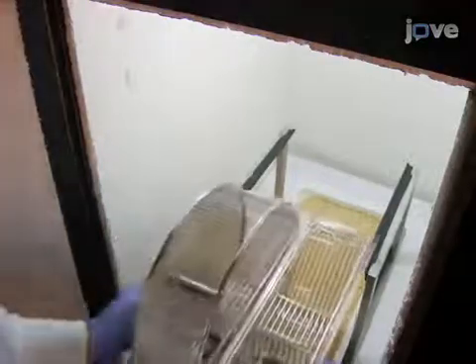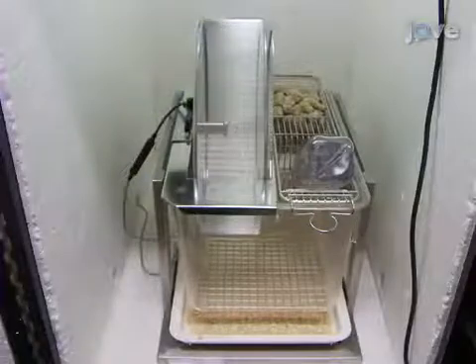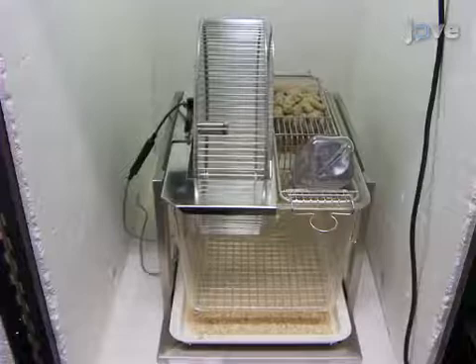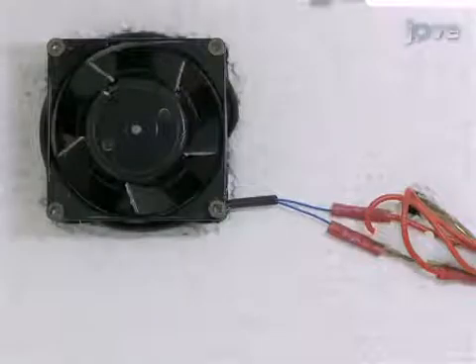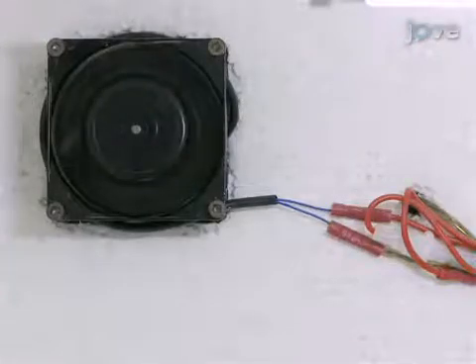Each cage is placed inside a sound-attenuated isolation box. Multiple cages can be housed together; however, cages housed singly avoid possible interference from surrounding odours. To allow for adequate ventilation, each box should be equipped with a fan that is hooded to prevent light from entering. Small, light-tight vents allow air to enter the box.